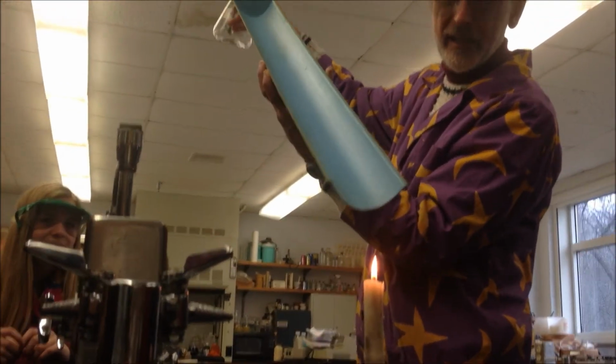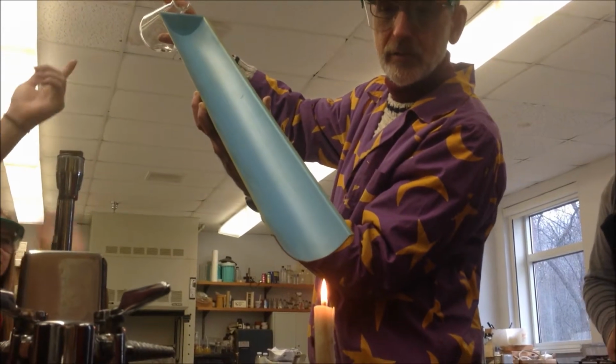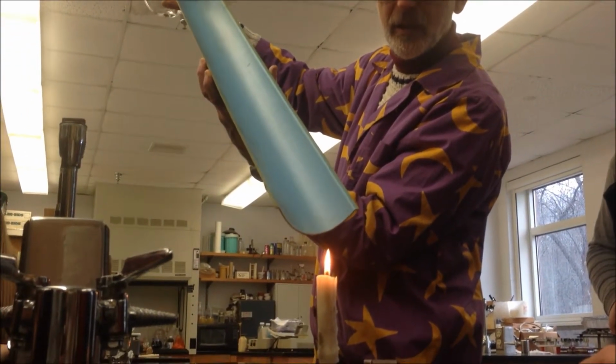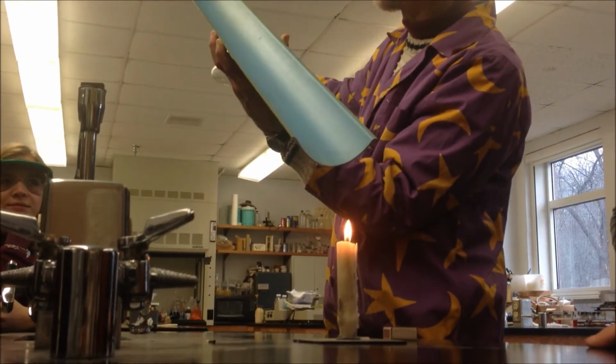I am pouring a gas. And what else can you say about the gas? It's flammable. You see it going down? Oh my God. How do you not see it? She sees it going down. Oh my God, it's going down.